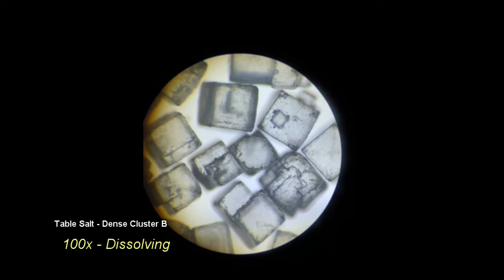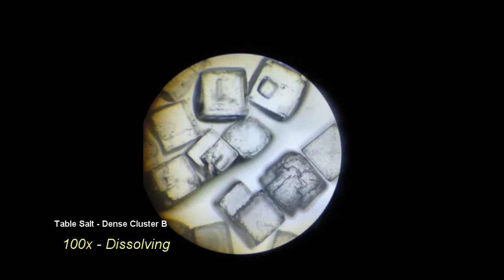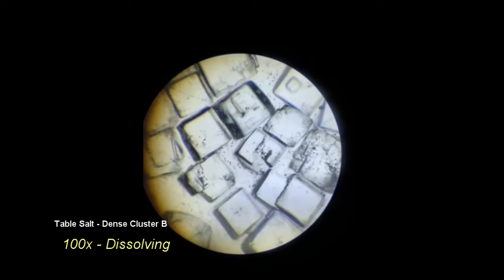This clip is of the same process as the last, a cluster of table salt crystals being dissolved in distilled water, but at a higher magnification.